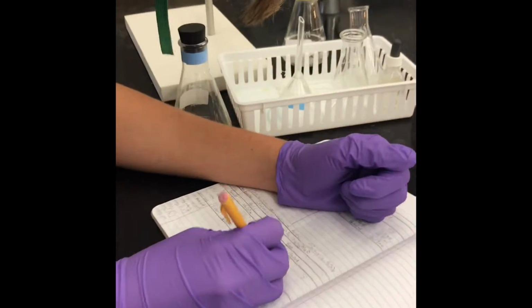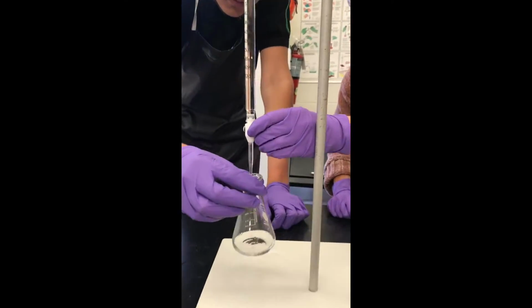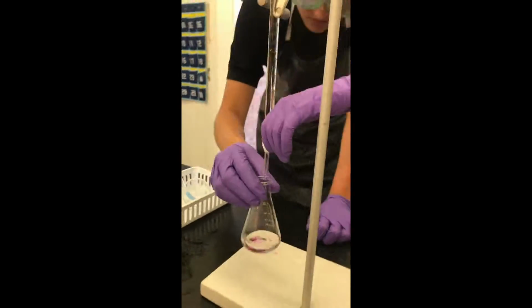The volume of the base was recorded to the nearest 0.01 milliliter as the initial volume. The flask was placed under the base burette. The base was slowly released into the flask.